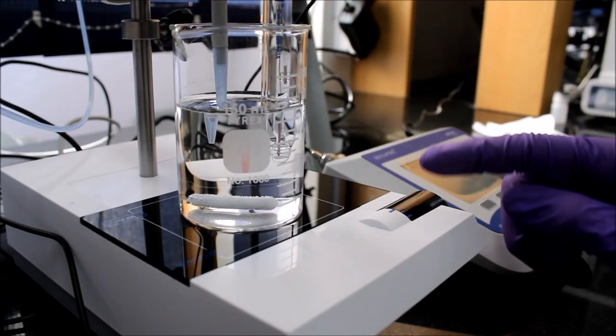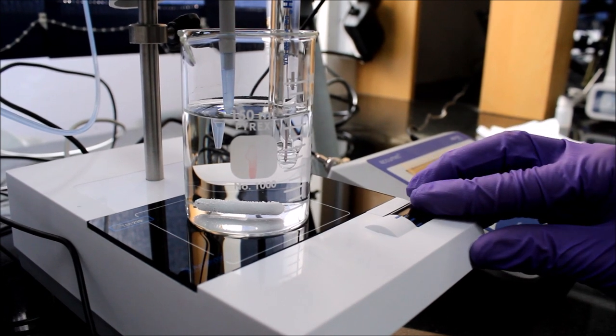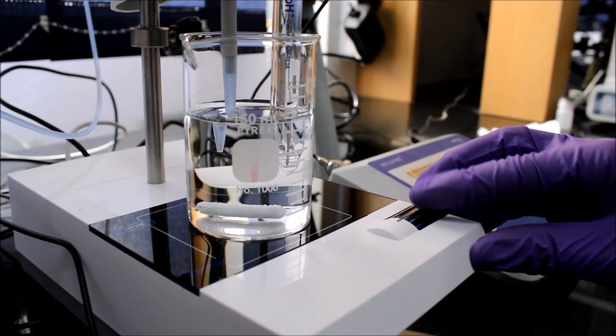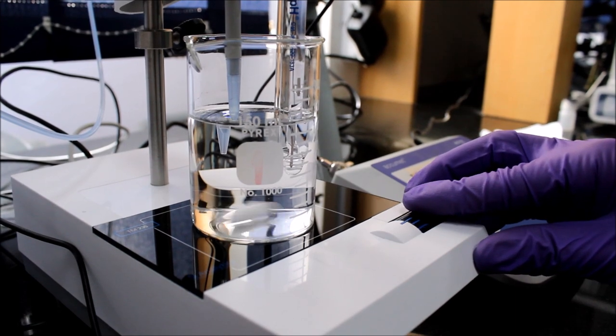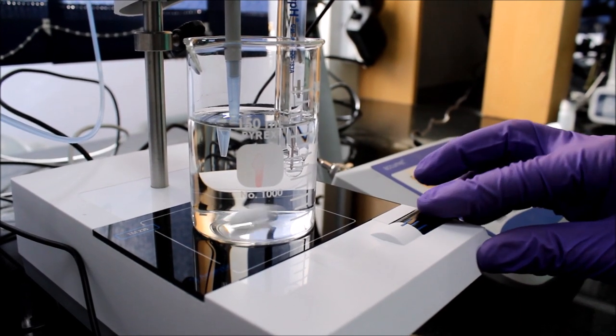Now we can turn on the magnetic stir bar by swiping the controller up. As we swipe it up, the speed increases dramatically, so be careful not to spill or ruin any solution sample.